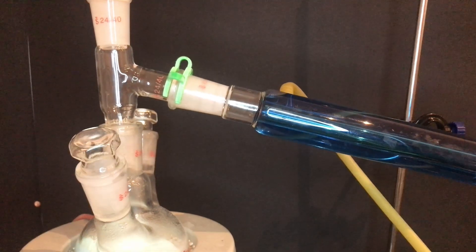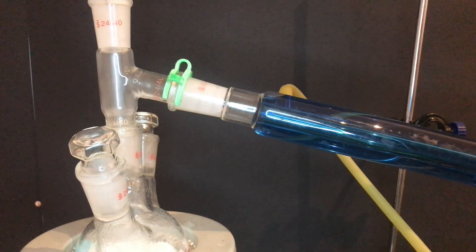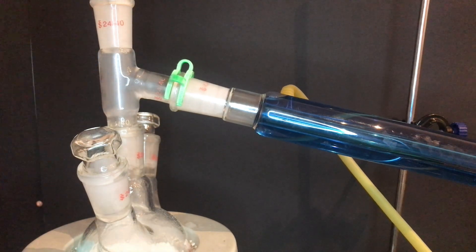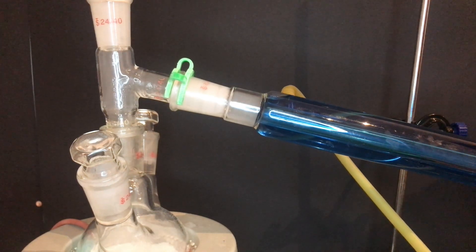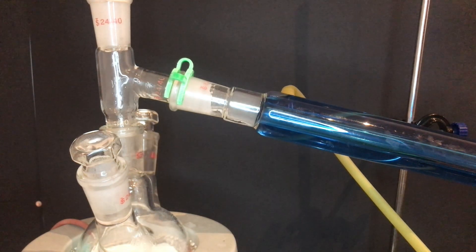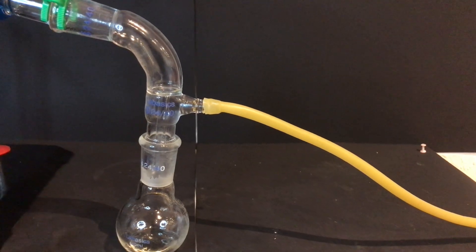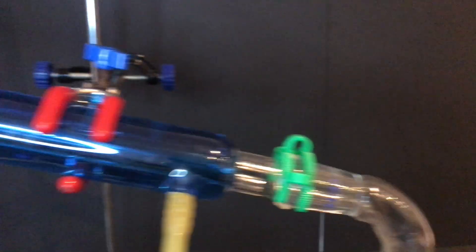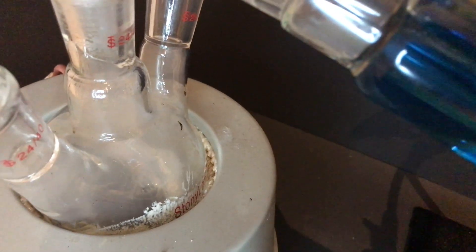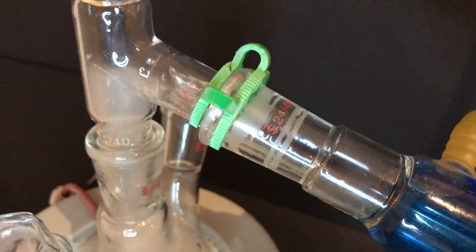After this I cranked up the heat to max, and after some time pyridine vapors came out of the flask and condensed in the condenser. I looked at the receiving flask and saw some pyridine drops dripping into it. At the end of the distillation I could see that the powders were molten and some nicotinic acid had condensed onto the walls of the boiling flask.